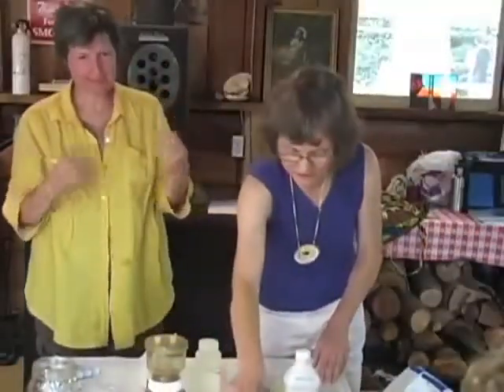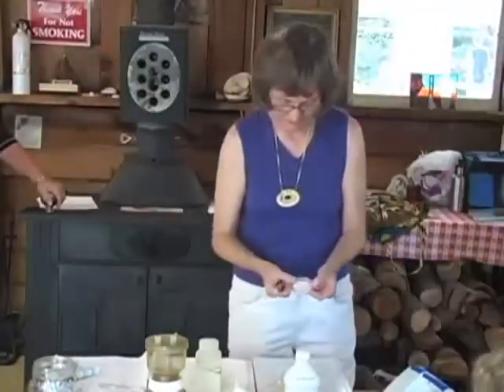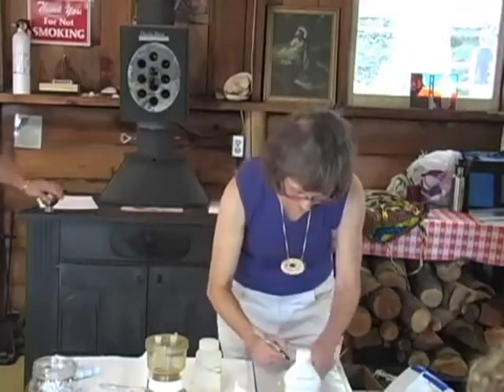Now the first step: Technician, you can go wash your hands. You know, I'm going to label it ahead of time. So you're gonna go wash, and you have to sing Pass Lake. Good idea. Is that in there?